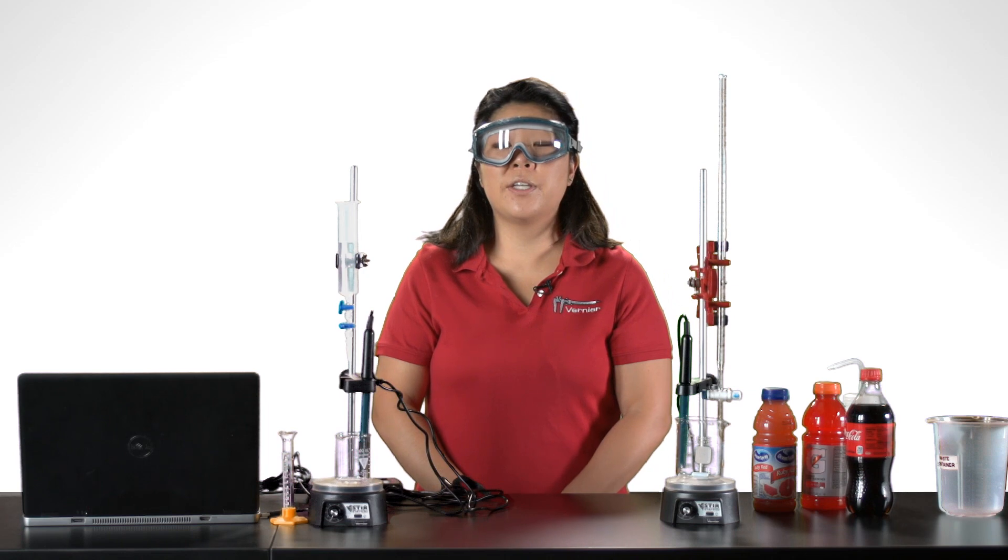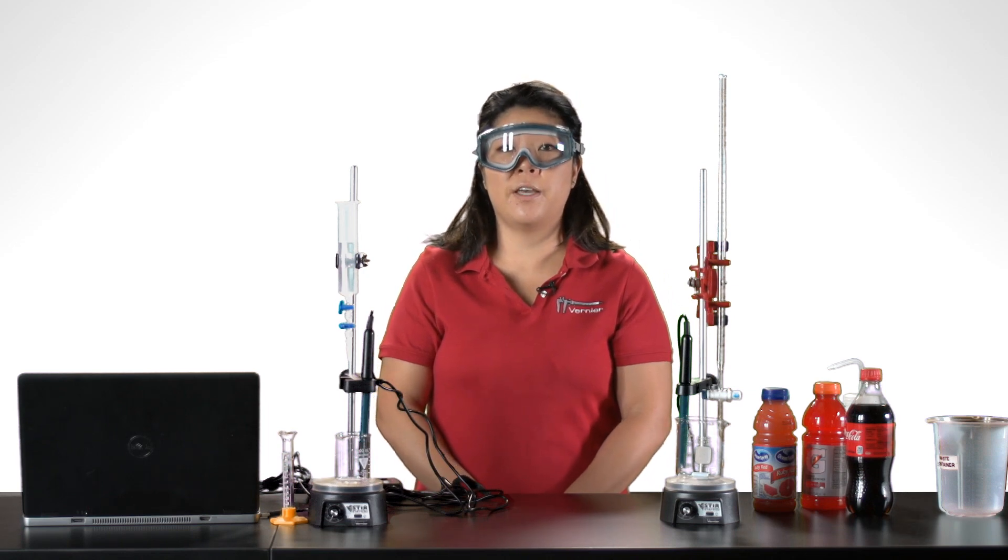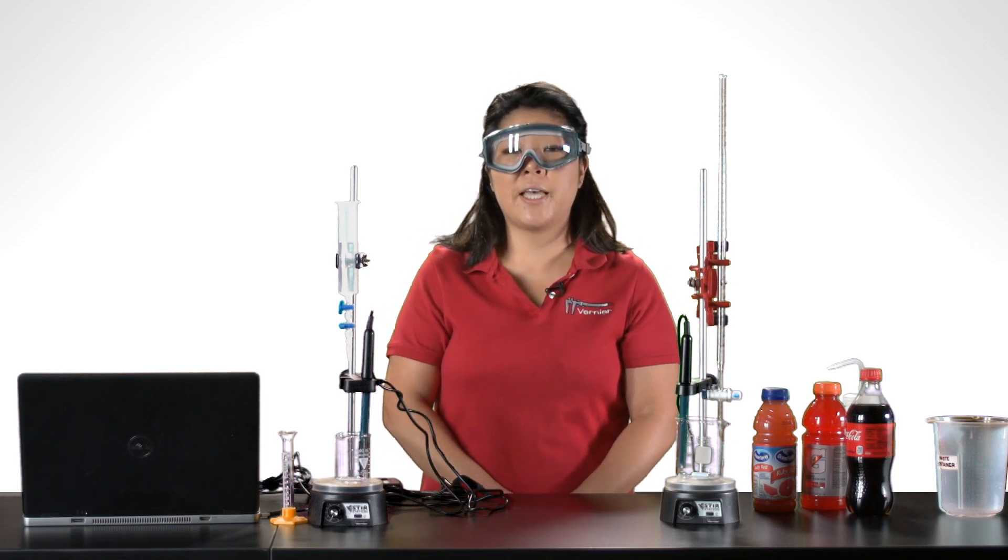The rate when you're calibrating should be no faster than approximately one drop for every two seconds into the graduated cylinder.